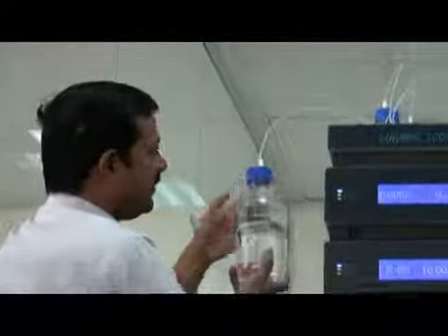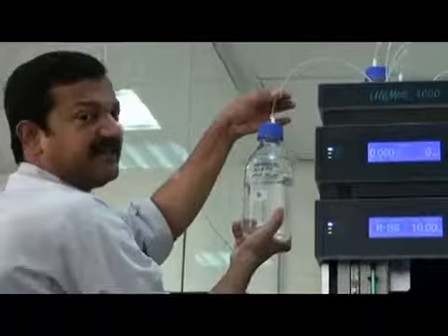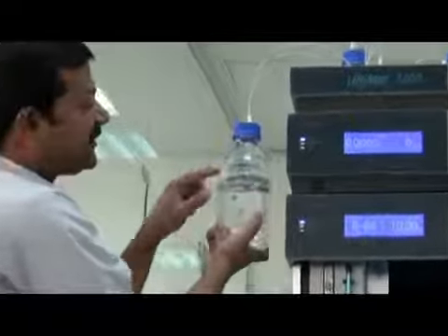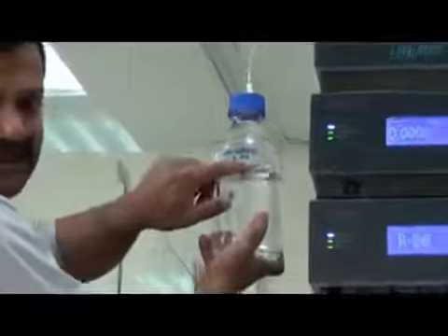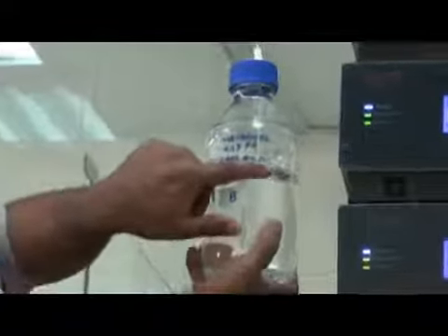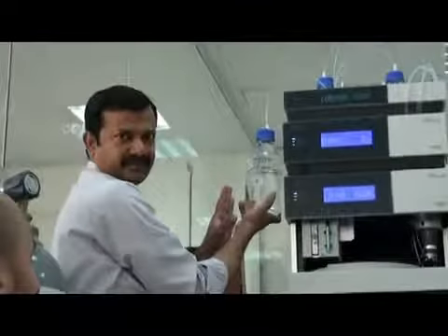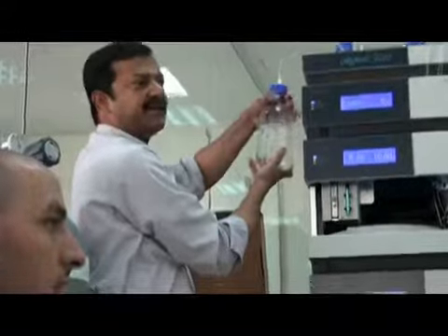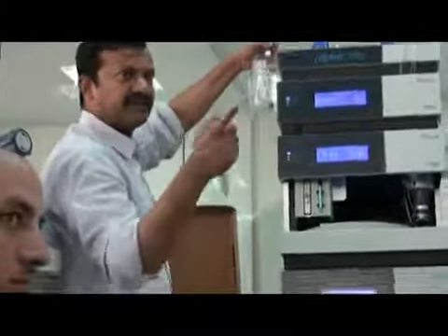Then come here. This is mobile phase B. The line is B, and I will put the label also here, line B. What is this? This is also 0.1% formic acid and 4 millimolar ammonium formate, but in methanol, not water. Okay, this is important. The solvent here is methanol, an organic solvent. Okay? Please keep asking, Shahid, if it is not clear, I will just explain.